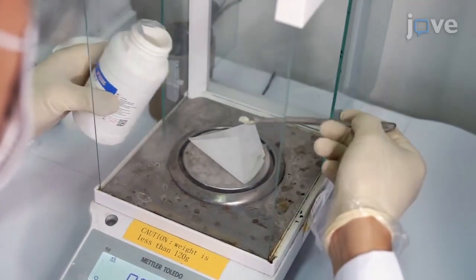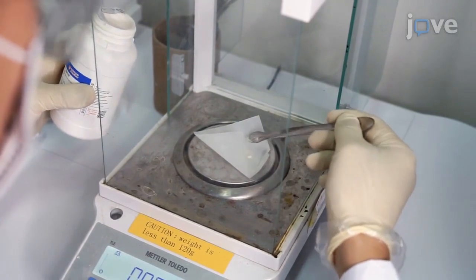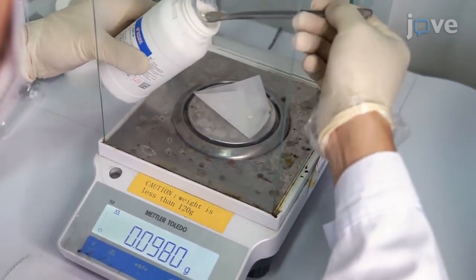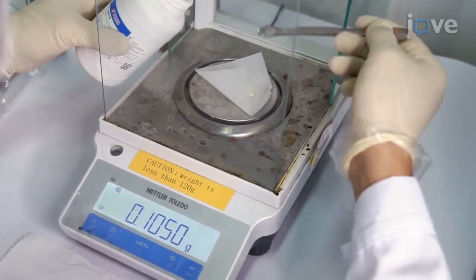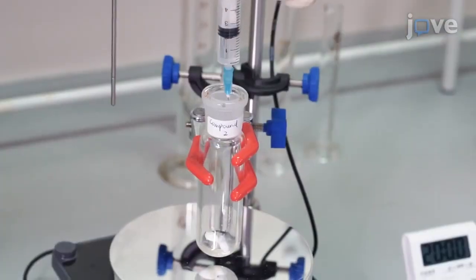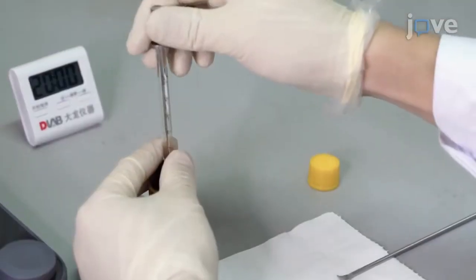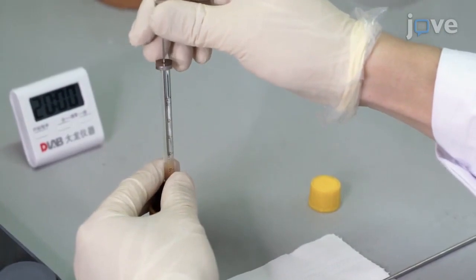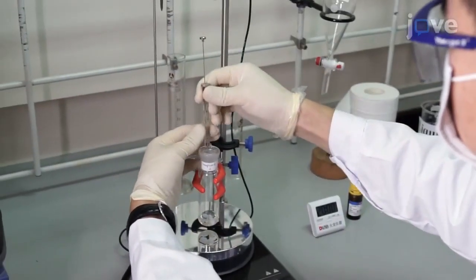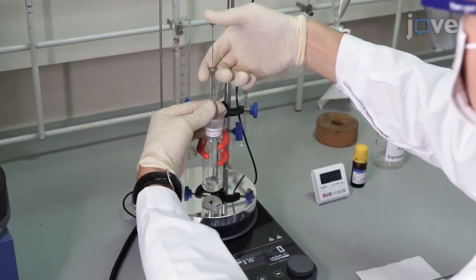To begin, place 133 mg of tetrabutylammonium iodide in an open reaction tube equipped with a magnetic stir bar. Add 3 ml of HPLC grade acetonitrile to the tube. Then draw 38 µl of p-tolylacetylene into a microsyringe, add it to the tube, and start vigorously stirring the mixture at about 1000 RPM.